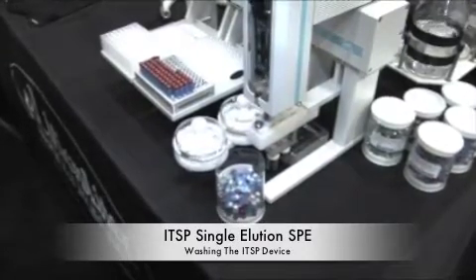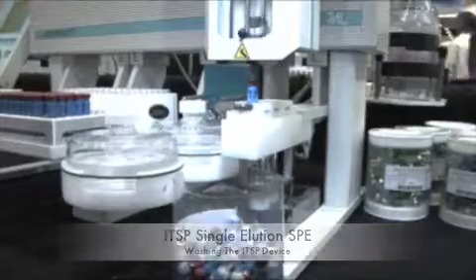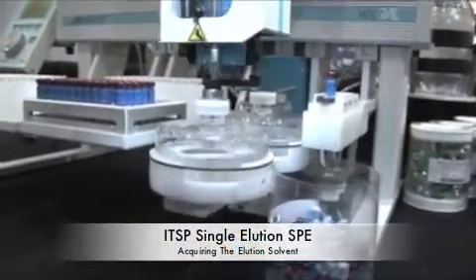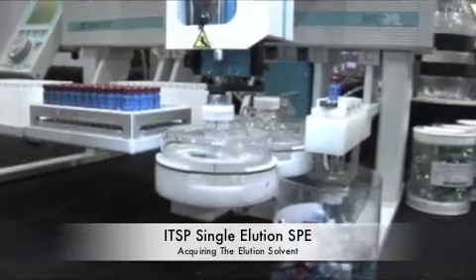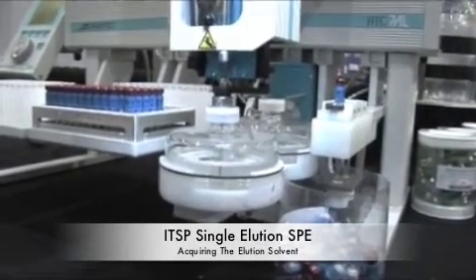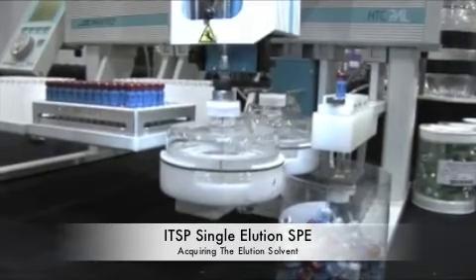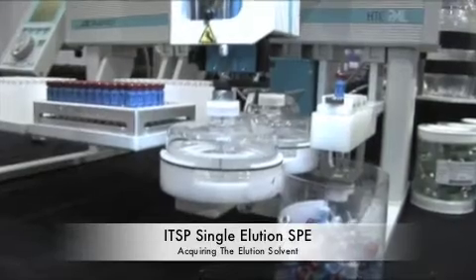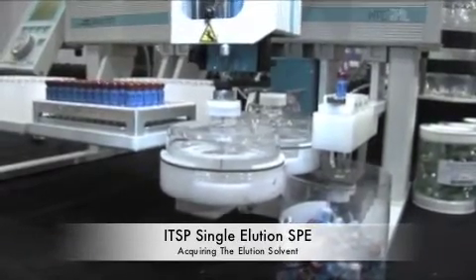So now we're washing the column. This is the last position. It'll stay in the waste receptacle. Now we're picking up the actual elution volume. And then we'll go back and pick up the device then, and that's really the uniqueness of ITSP, is that we can pick up the device and move it around the deck to do these types of extractions.